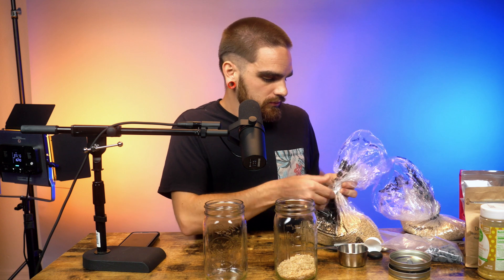Just for fun, we're going to do a little experiment — I'm going to use whole oats in the other jar. I grabbed a bunch of whole oats the other day thinking they were wheat berries or rye berries, then noticed once I started simmering them they got really soft. I think they work really well, you just have to be more careful with water saturation because they get all squishy. We're going to see if the cordyceps like them.